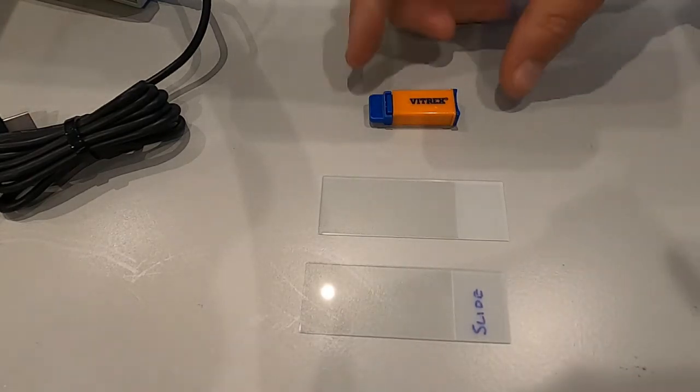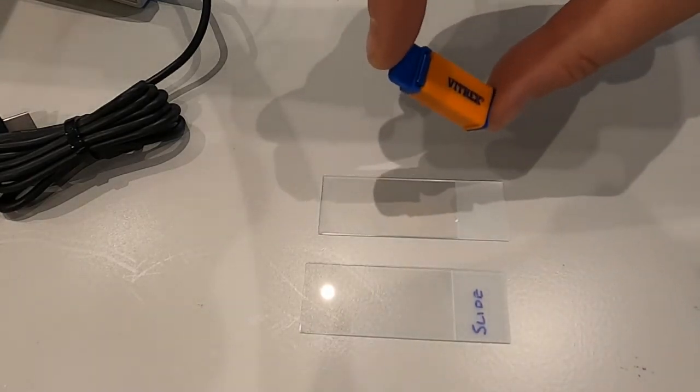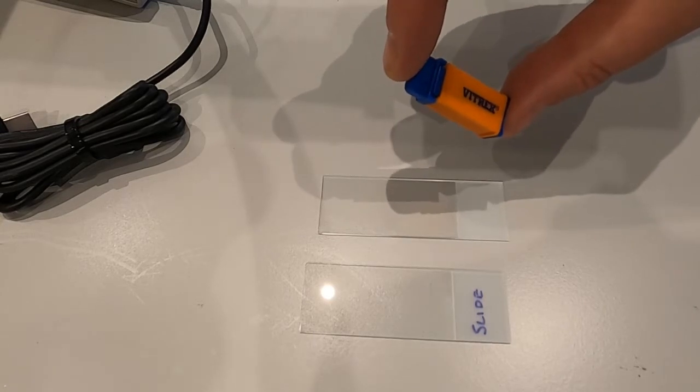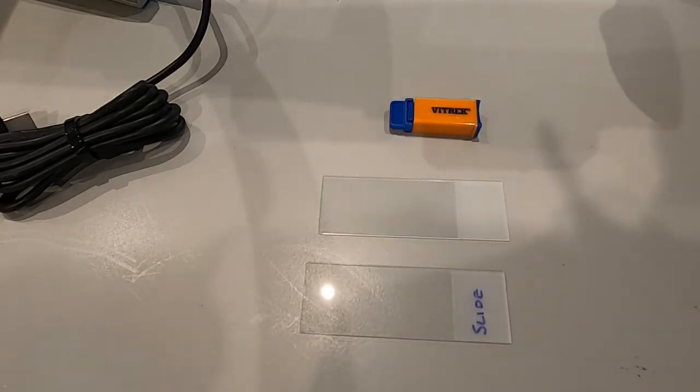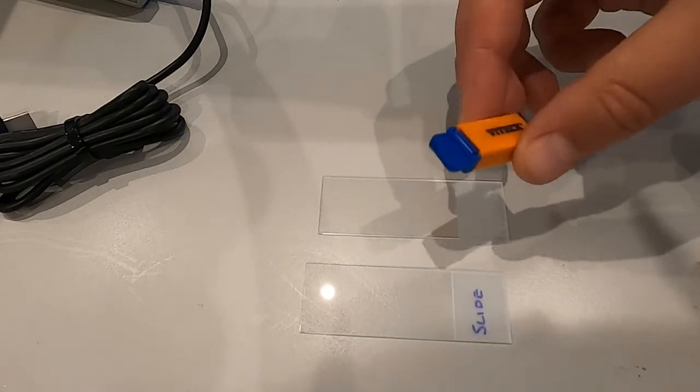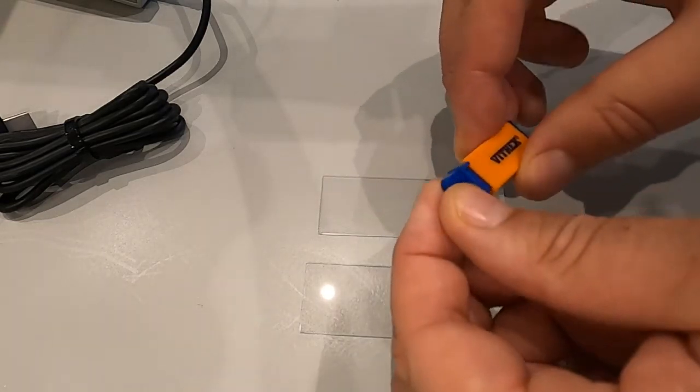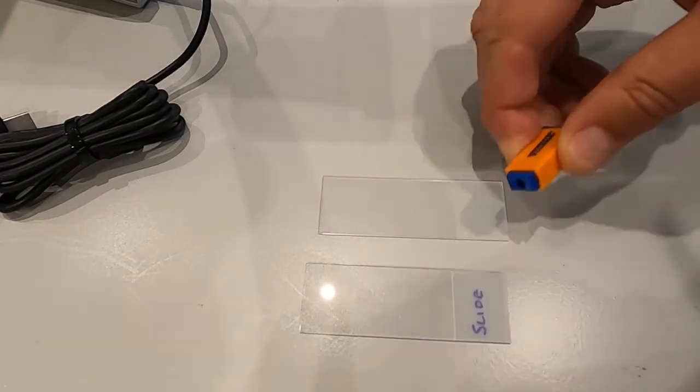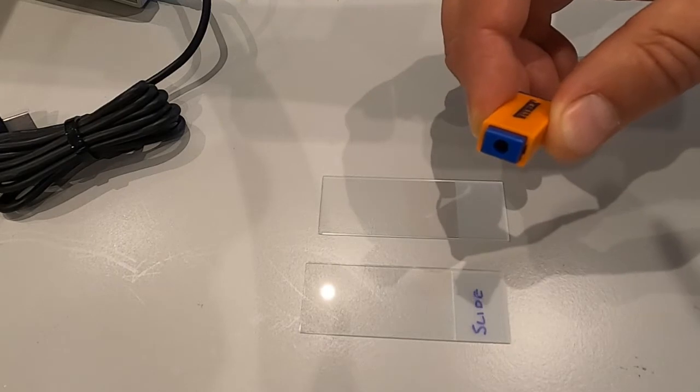The second piece is a little skin prick device to obtain a blood sample. These are very easily done. You take your skin prick, twist the top and pull. That releases it.